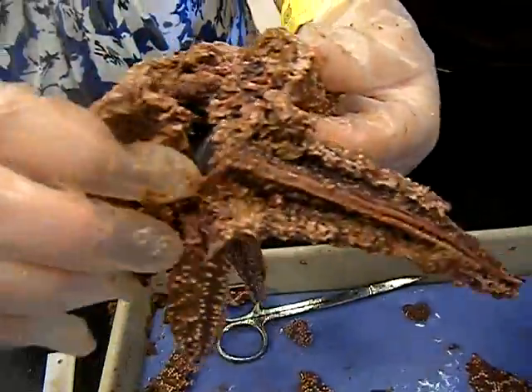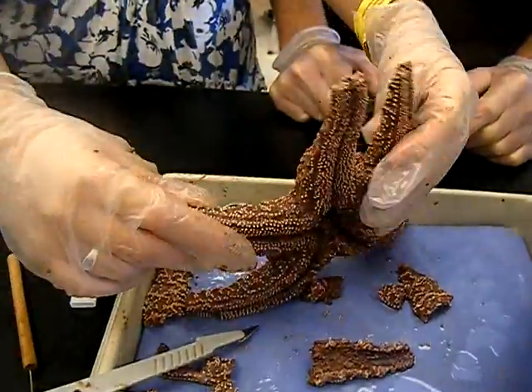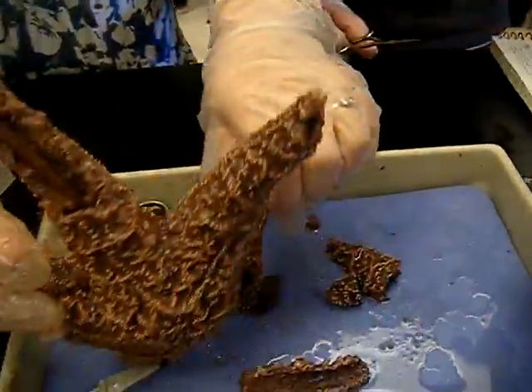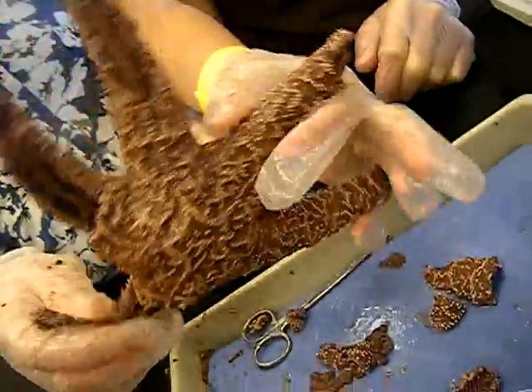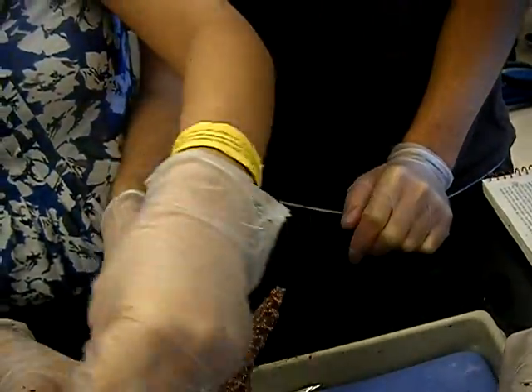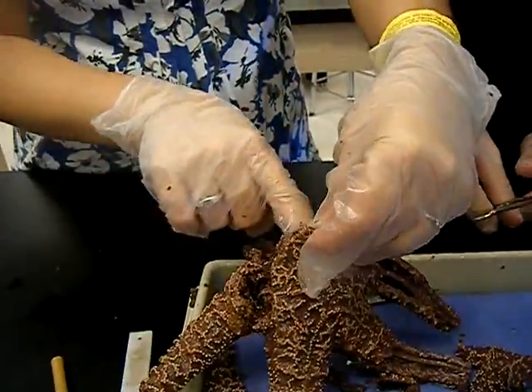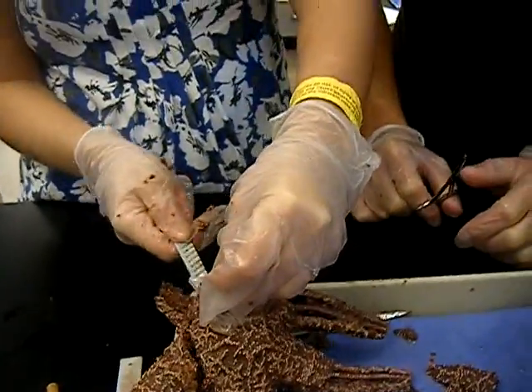Hey, let's do a dance in front of the camera. Wait, it needs to be like — face the other way. Yeah, so our faces are in the shot. There's a hole in its stomach. Ew. Good touch. Look, there's like a hole there — it goes through. We have to cut it like this. Where's the scalpel? Scalpel. He's not gonna make it.